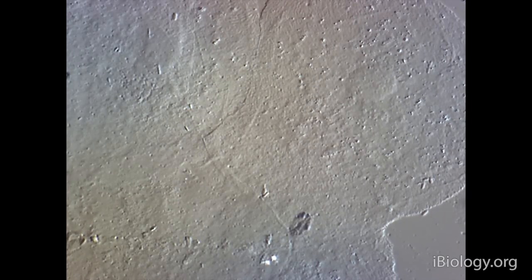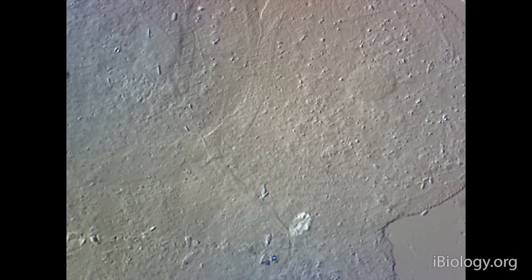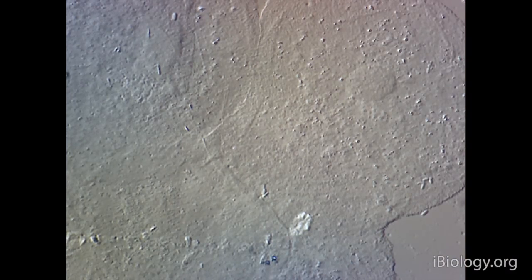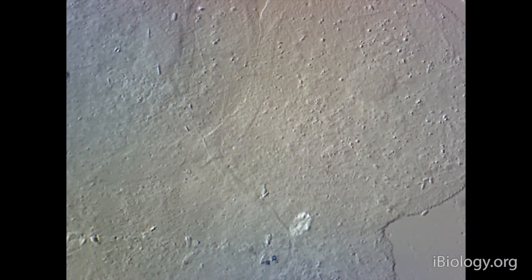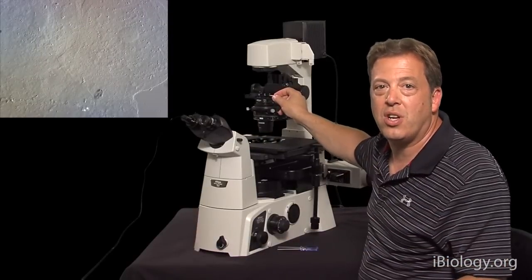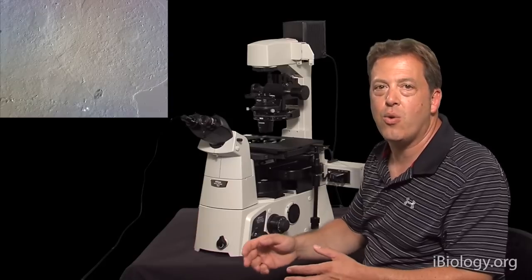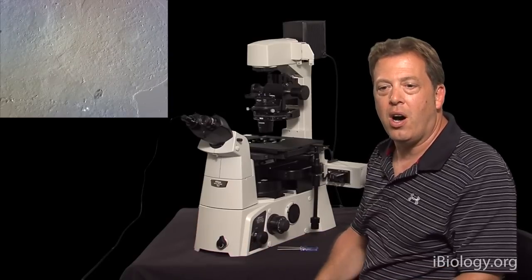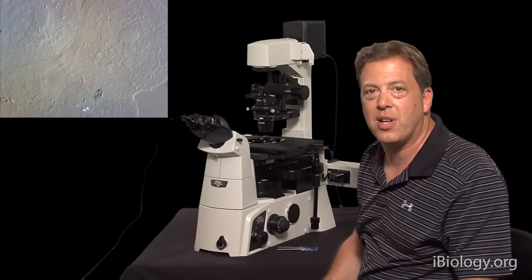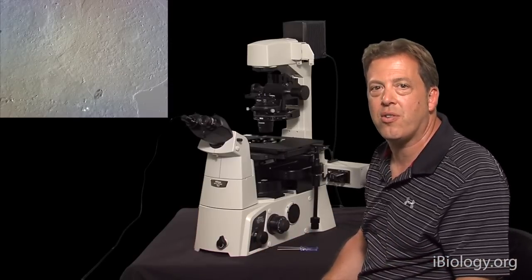An important thing to notice is that when you go to the other side of extinction, you actually change the directionality or shadowing of the DIC image. You can see the shadow on one side, and going through extinction to the other side, the shadow flips orientation — it looks like the light is coming from the other direction. In DIC, it's very important that you orient your specimen to enhance the contrast of the structures you're interested in, because you only have contrast in one orientation in differential interference contrast.